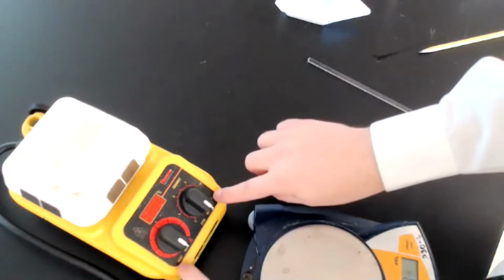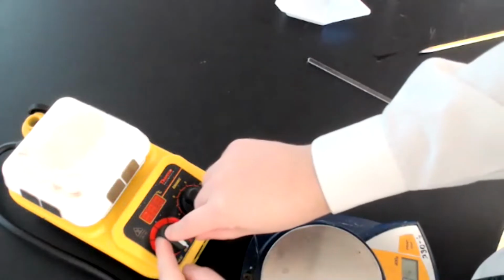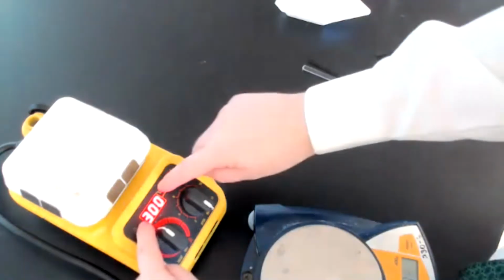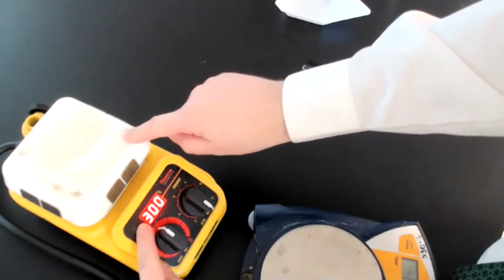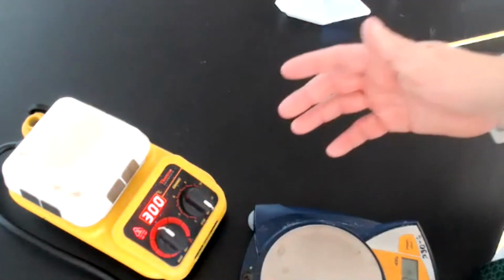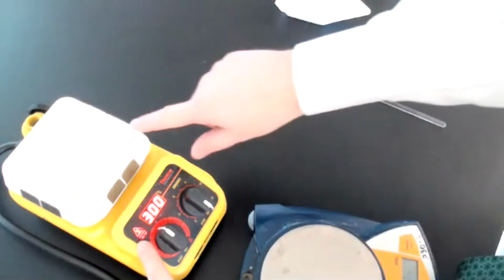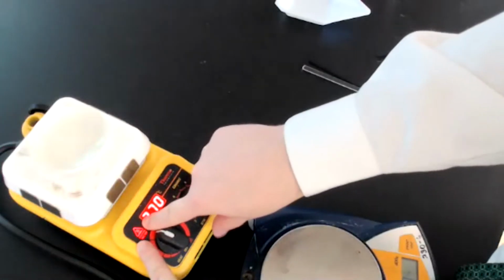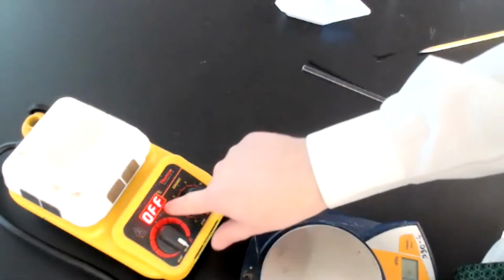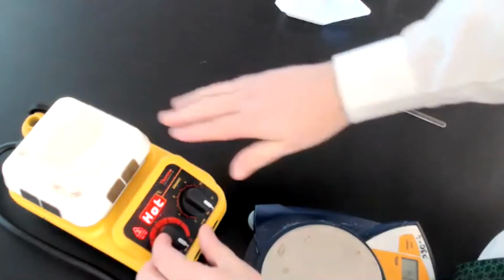So just so you know, there are 2 sides to these hot plates. One is a stirring mechanism, which is over here on the right side. This is the heating mechanism on the left. So we can heat it. Now, this is the temperature that this metal plate will reach. This is not necessarily the temperature inside of the solution, but we definitely want to make sure that we get it to a temperature that is above 100 degrees Celsius, right? As soon as the hot plate top becomes hot, this light will turn on here. I'm just teaching you a few things about using this. So when you turn this off, this will say hot and off to remind everyone that, even though it's not heating anymore, that surface is still hot.